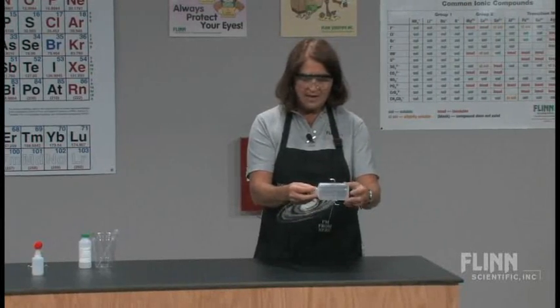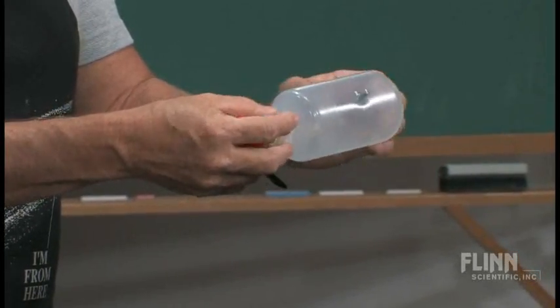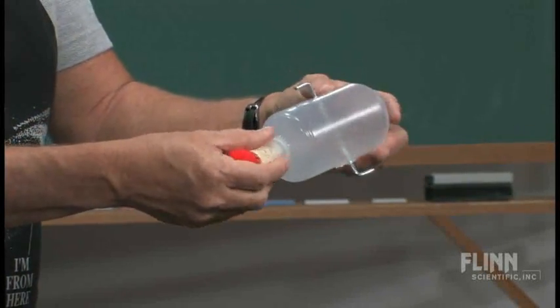With this one I can actually see the alcohol as it's rolling around the sides. I can kind of look to see how fast it's evaporating. There's a little bit of alcohol remaining there, but not a lot.